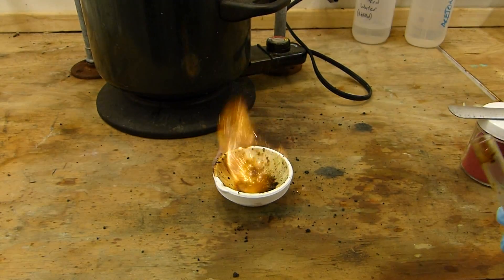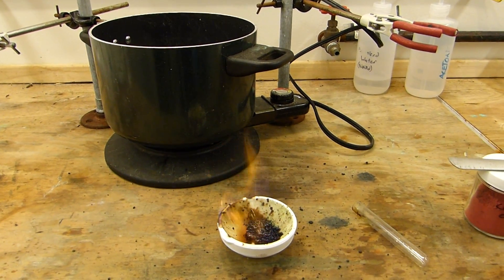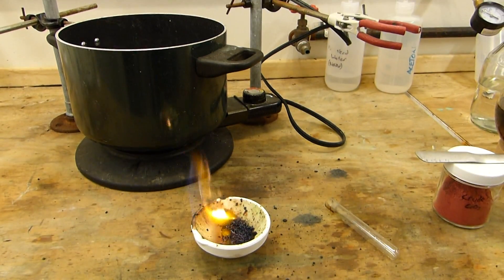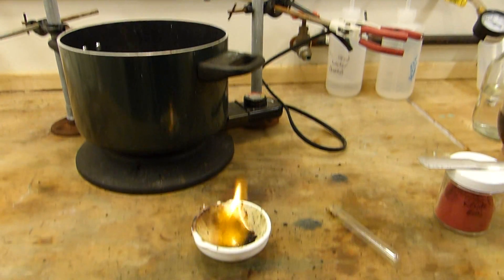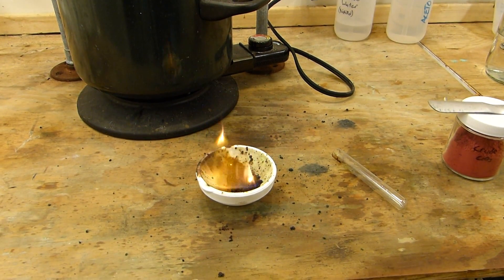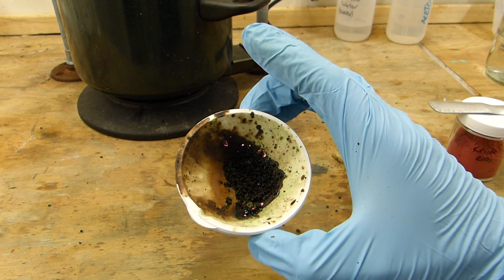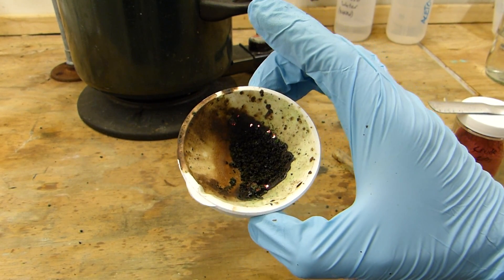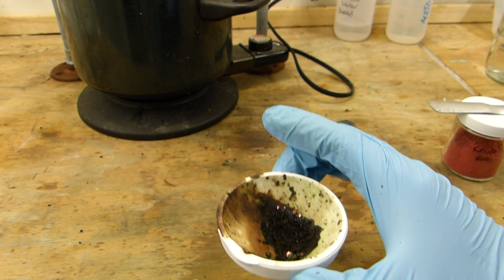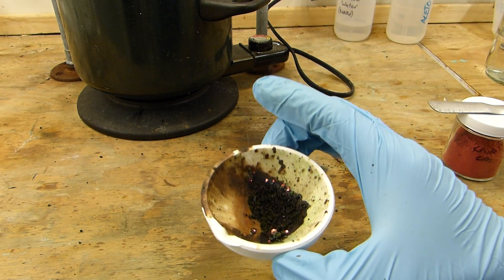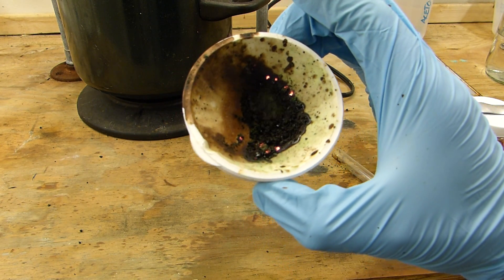As you can see, it instantly bursts into violent flames. You can see that there is some green coloration there, and that is because the chromium trioxide has been reduced all the way down to chromium three oxide.